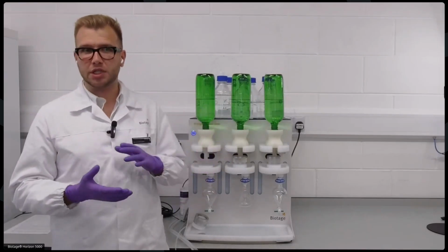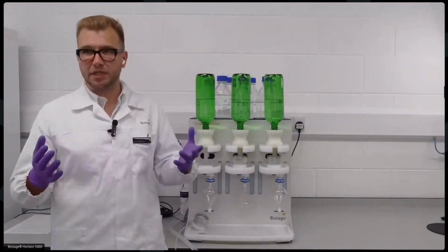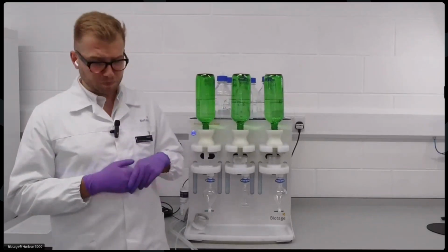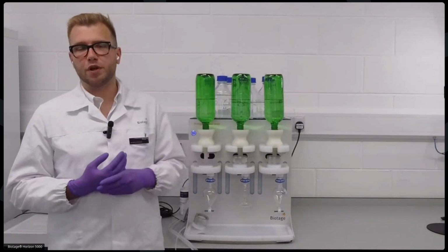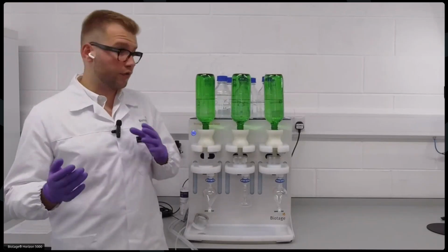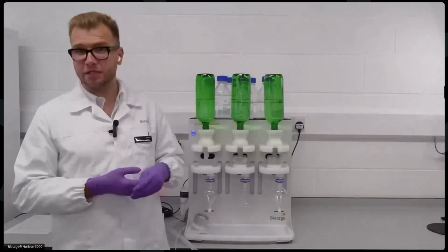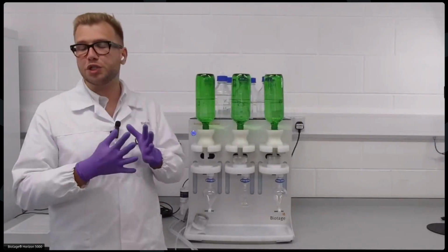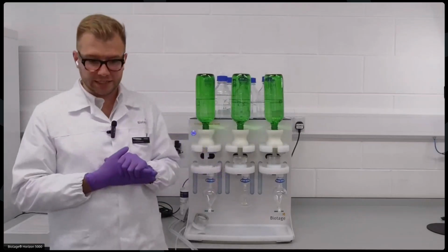They will contain really high amounts of suspended solids, particles, sediment, or any of the above, including organic materials. Now, those sort of characteristics of a sample will very often clog your cartridges. And this is why we've created the Horizon 5000 system, which uses disk SPE technology. And it was really created with one focus in mind, and that's one system for every sample, no matter how dirty that is.